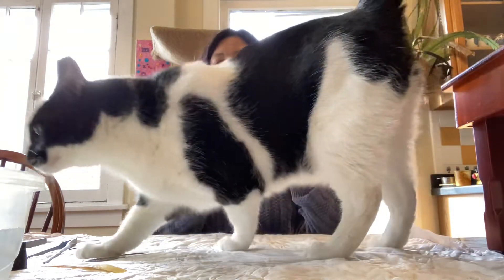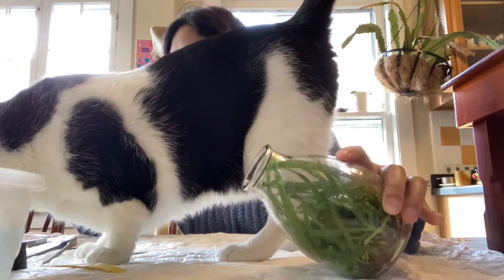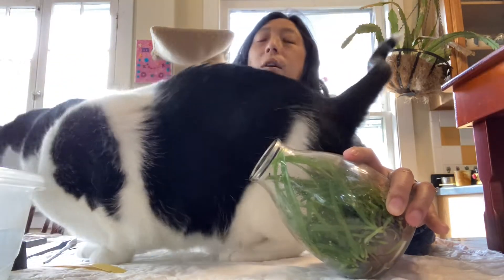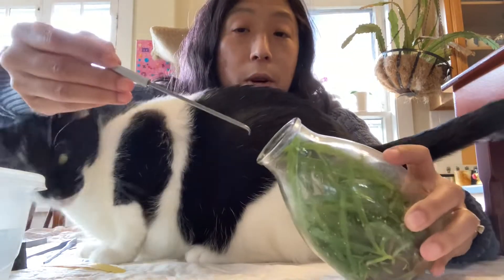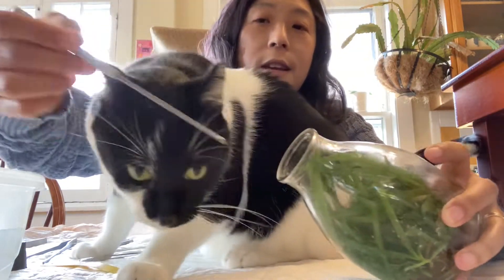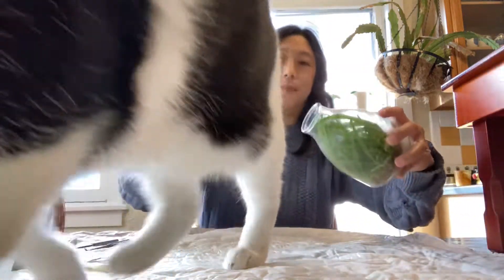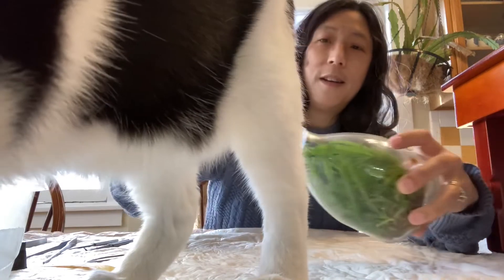Well, we'll just try to do this with Pinto here. First tool. This makes it all that much more exciting. So the idea here is no Pinto — you don't need to snuffle it. The idea is to try to hook it out.